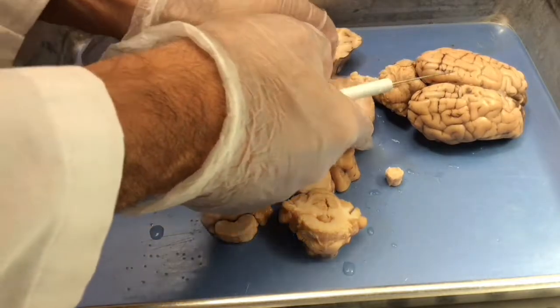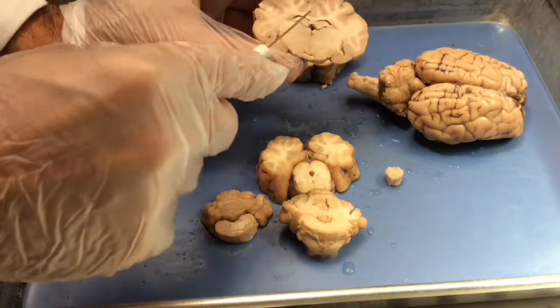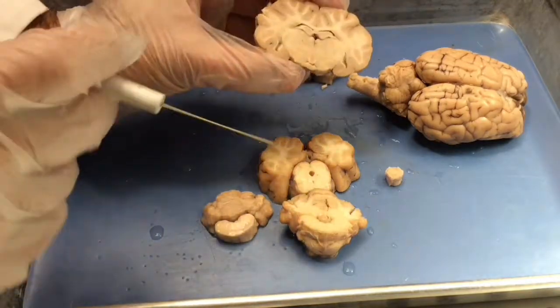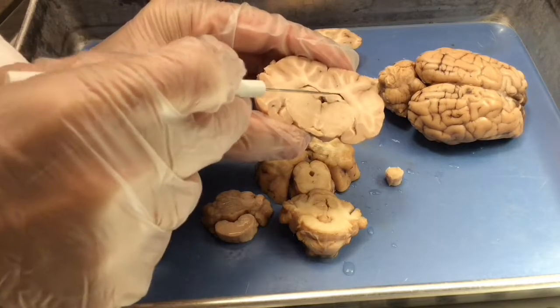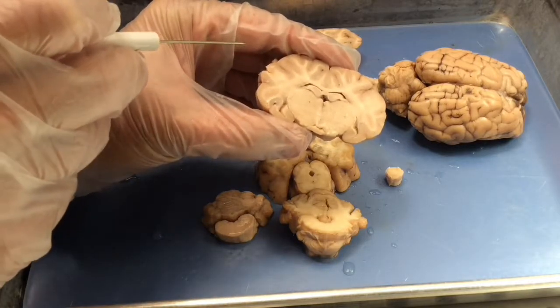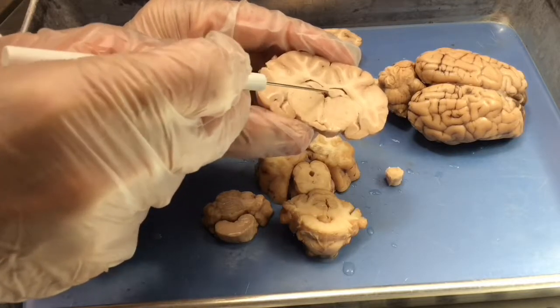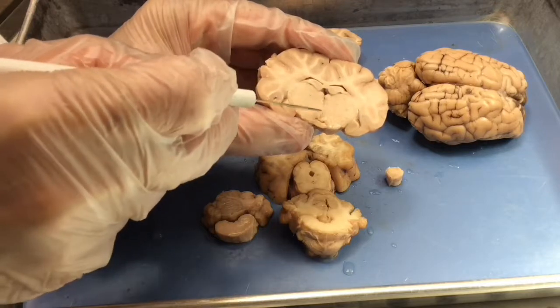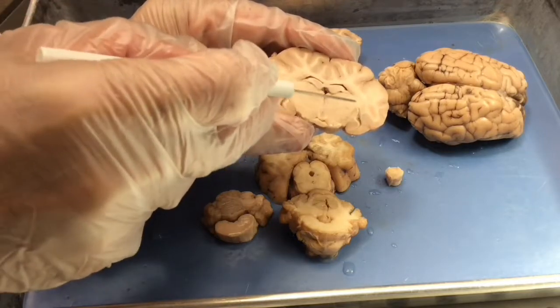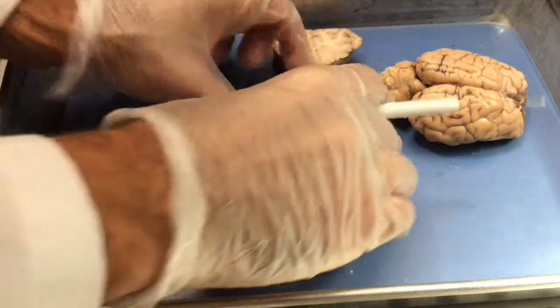As you move further back in the forebrain, the cortex gets a little bit smaller, subcortex gets a little bit larger, and now the dramatic structure is the hippocampus, which looks like goggles on the top surface. The hippocampus separates the lateral ventricles from the third ventricle, which is both here and here. Kind of makes a T shape. The subcortex here is thalamus and hypothalamus.